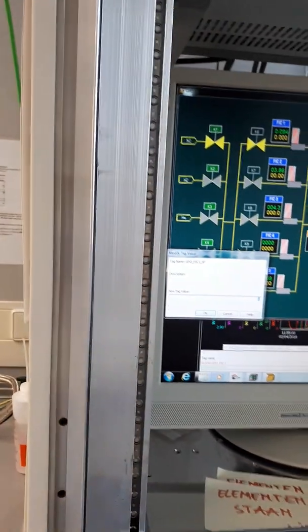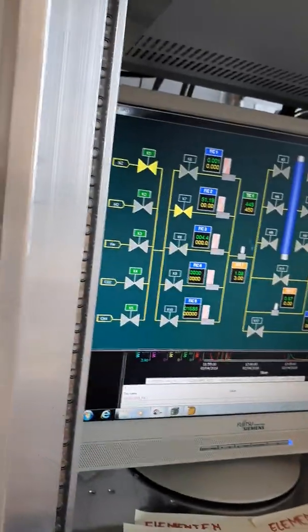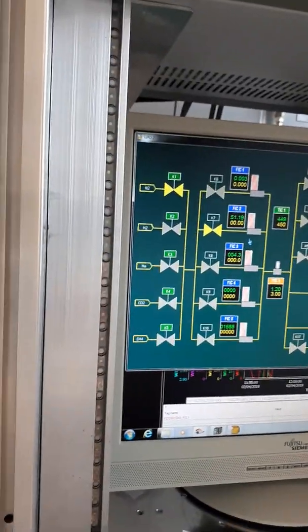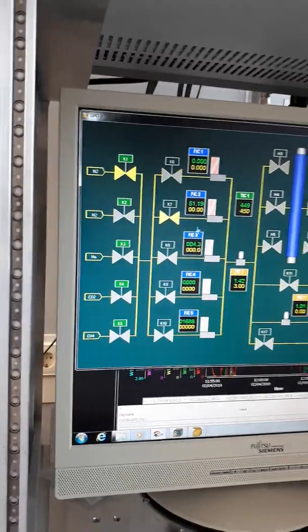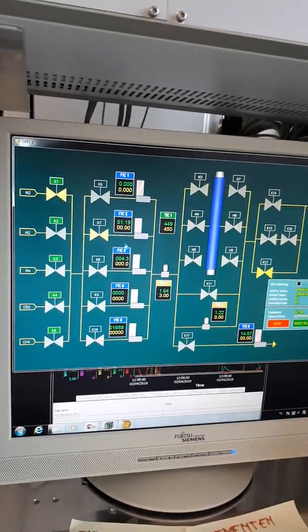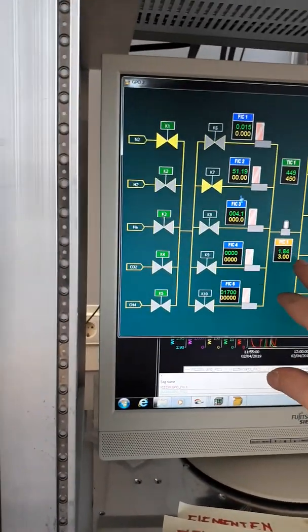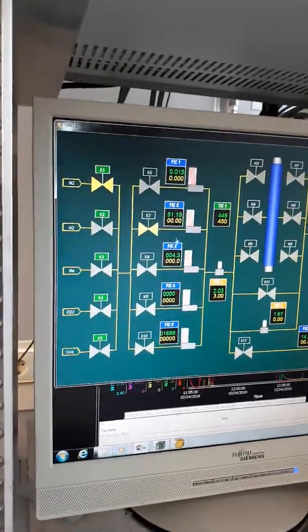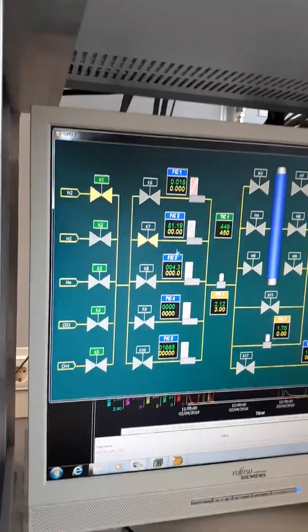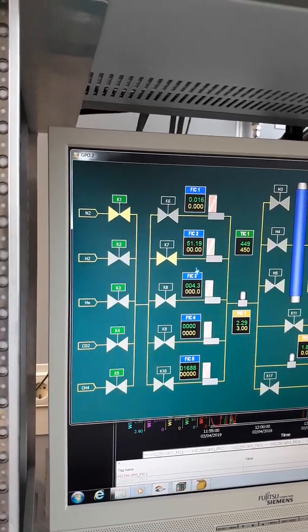Put this one a little bit faster up. I don't care, but this one surely will not break. No, I think there is more leakage. I guess. I hope, maybe. There can already still be some membrane. That's possible, because there is a layer. You see a layer. But I see it already increasing a little bit slower with 50 milliliters a minute compared to what we had before. On the other hand, it's shorter, that's true, but 90 millimeters compared to 120 millimeters. That's a quarter less.